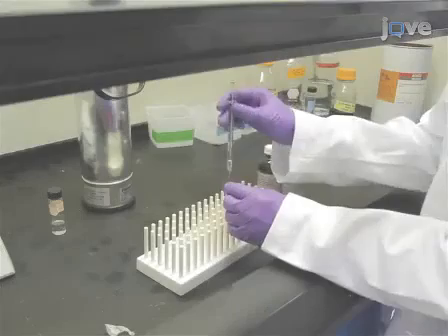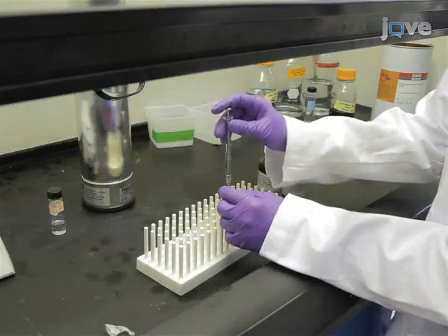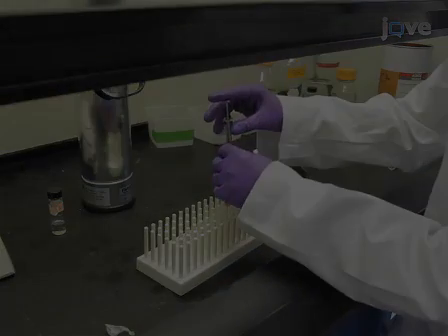The first step of this procedure is to prepare large unilamellar lipid vesicles, or LUVs, to serve as cell membrane mimics for the assay. Begin by combining phosphatidylcholine, phosphatidylglycerol, and 5-dimethylamino-naphthalene 1-sulfonyl phosphatidylethanolamine in chloroform.